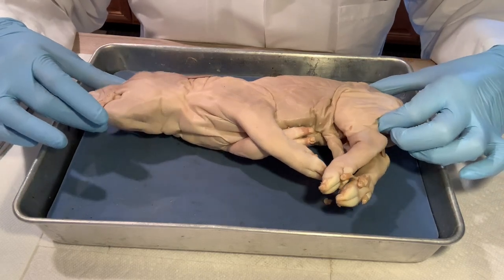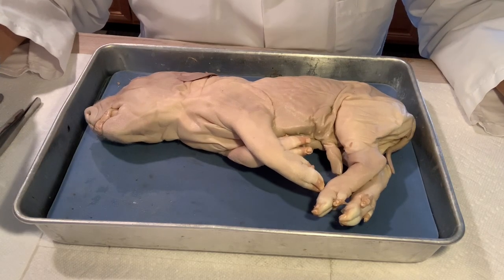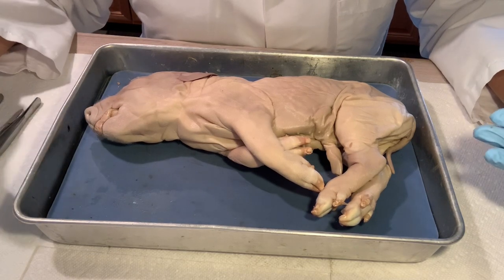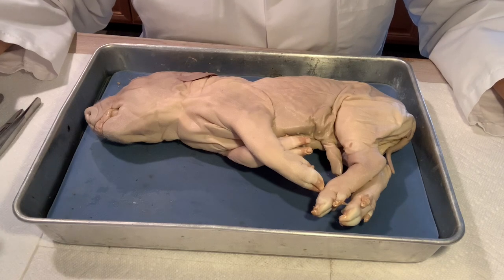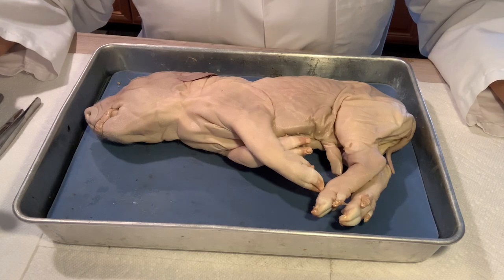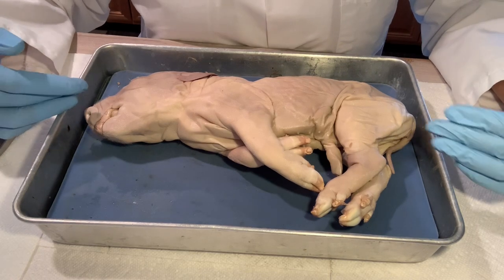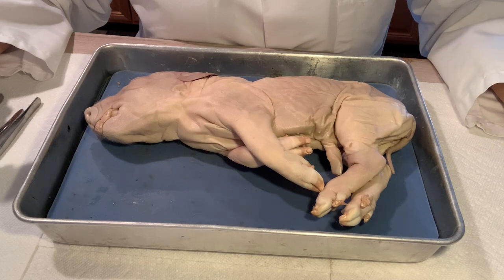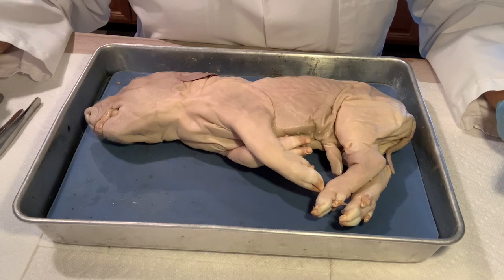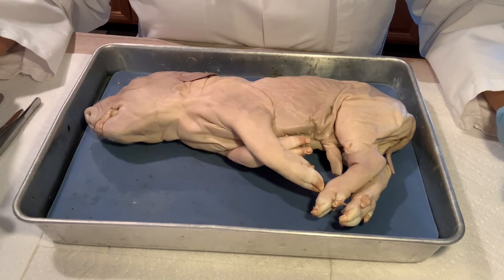Here is the whole animal, and we consider it an experimental model because we choose these pigs to study our own human anatomy. What do they have in common with us? They are mammals, and although much smaller than a full-grown human being, since all their organs are formed we will be able to see their appearance and location. There are some slight differences with humans but overall it's very similar.